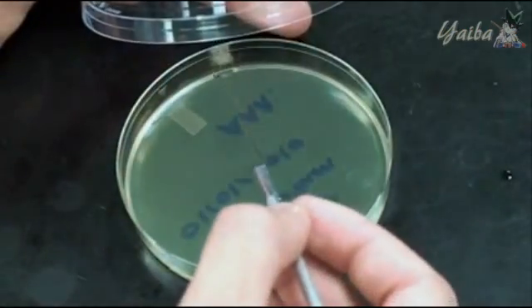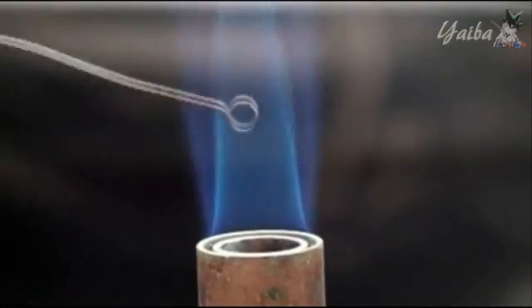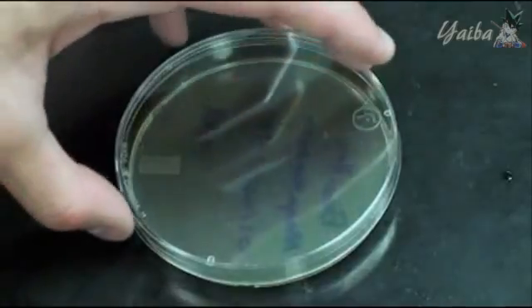To streak your new plate, touch the loop to the agar near the plate's edge and gently stroke it back and forth across about 1/3 of the agar's surface, to cover it with bacteria. You will perform strokes like this 2 more times, and after every time you will have to re-sterilize the loop. You will not, however, take any more bacteria from a culture.